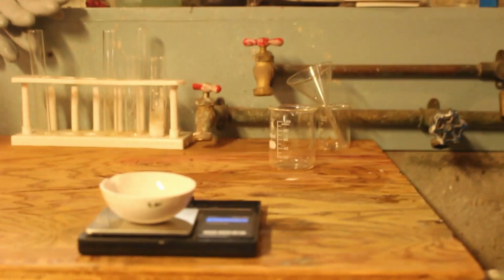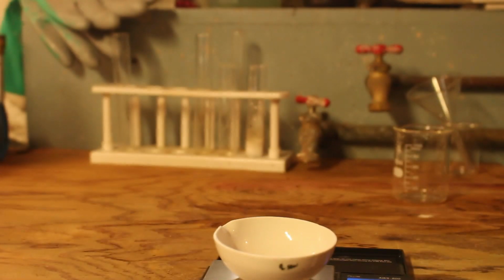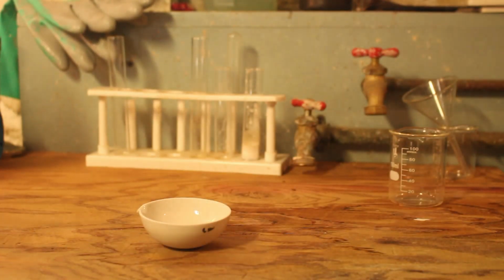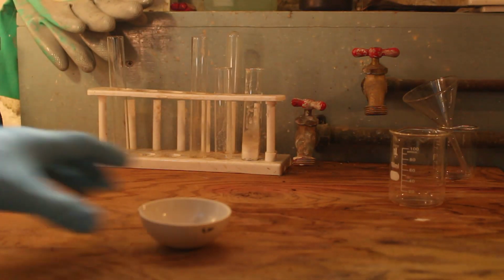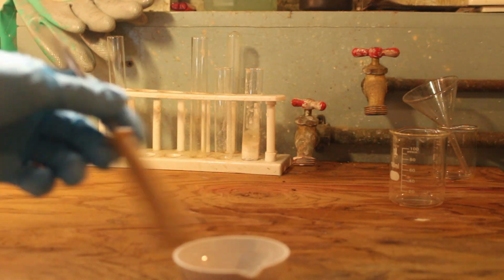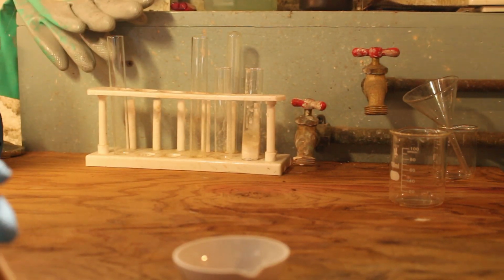As you can see here, we've got quite a few capsules or pills. And of course we need to crush them. Now you might be like, hey Liam, use your mortar and pestle that you have. I cannot be bothered to clean it thoroughly enough, so I'm literally just going to use this evaporating dish and the end of a screwdriver. That's how lazy I am. And I'm going to skip this part for you guys because it doesn't really matter.